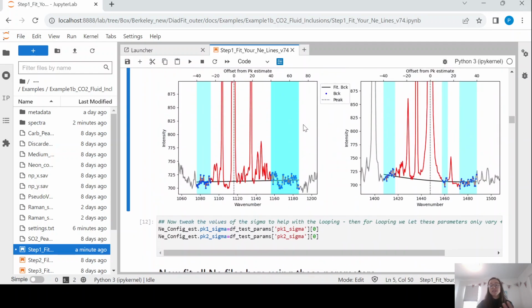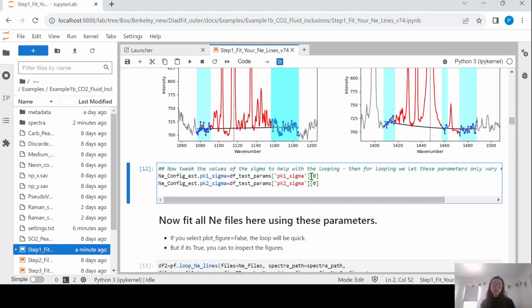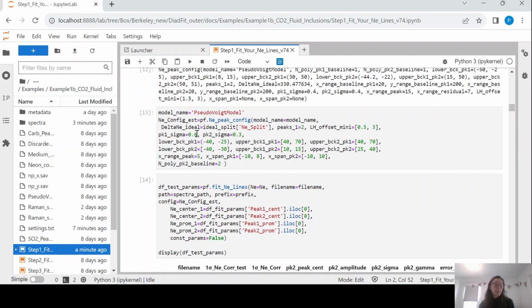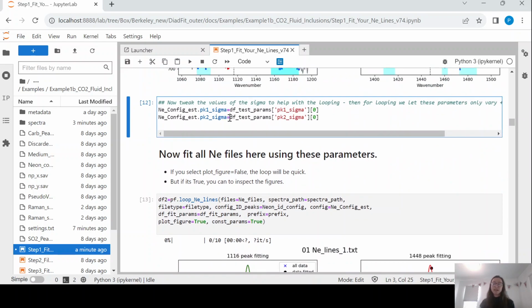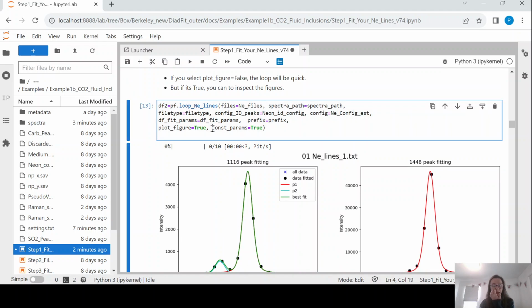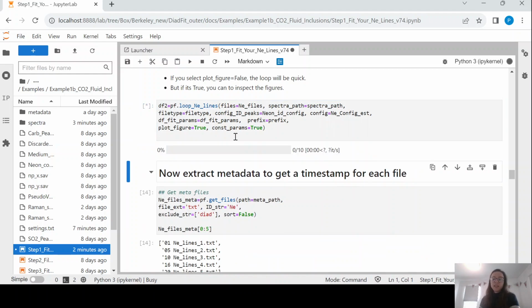And the point of DiadFit is you tweak the fits for one of these. Once you tweak them for one of these, you're good to go. So now we loop through all of the neon lines and you're not having to retweak them. And most importantly, once you've tweaked this once for one instrument, you don't have to tweak it again, realistically, as long as you inspect that it looks reasonable at any one time. So what we're doing here is we're just updating. We guessed a sigma value, so we guessed 0.6 and 0.3 for the width of the peak, which we update with what we got for that first one, because that's better than my random guess. Now this loop neon lines file basically loops through every single neon line and fits it. So you can see we've given you a little progress bar, so here we're fitting 10 neon lines.